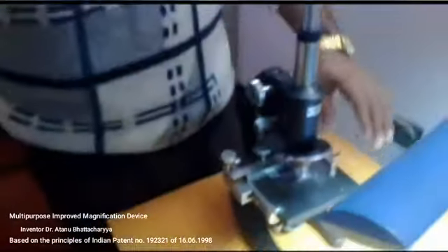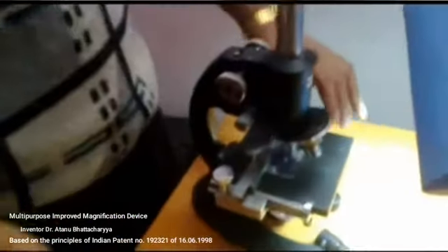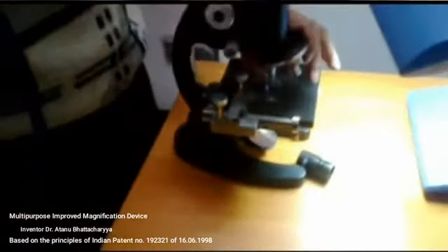Now this device can be used for dissection purpose also, because it forms an erect image, and for that purpose a low power objective has to be used.